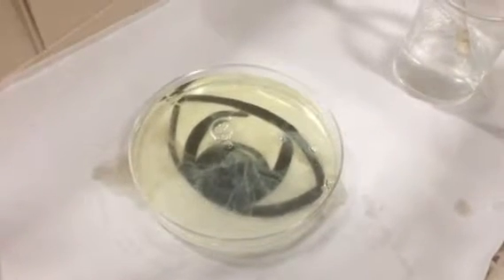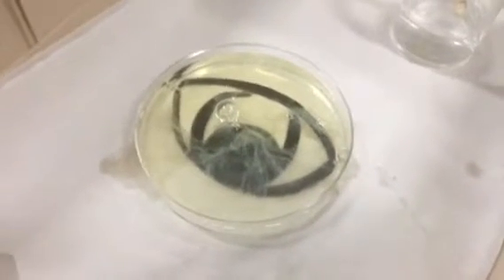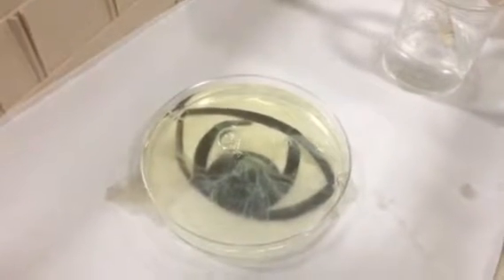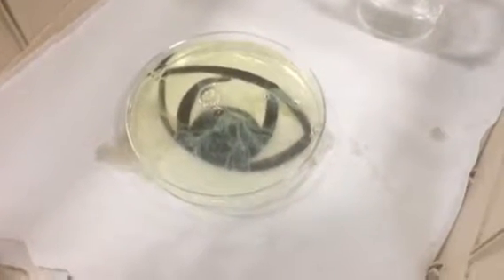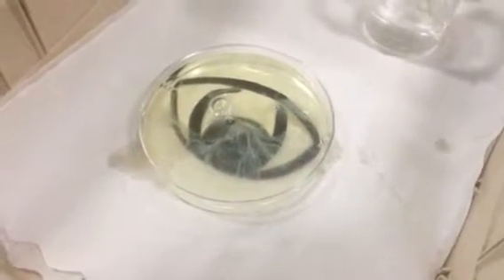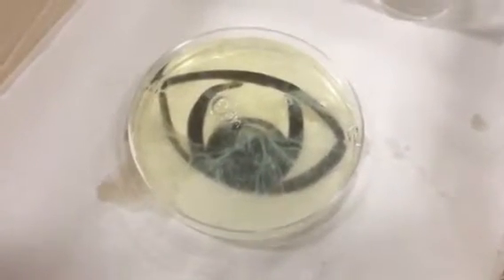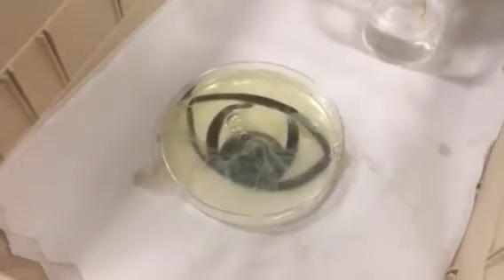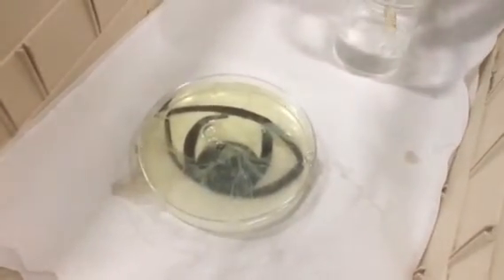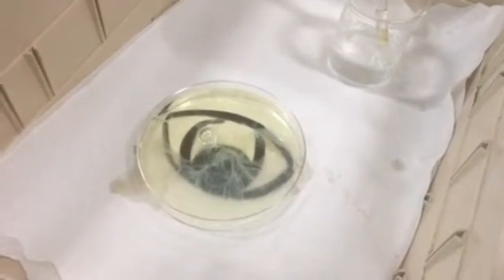So that's why you're going to wear what the whole time you're in the lab? Goggles. But what if your goggles get foggy and kind of annoying and you feel a little uncomfortable? Do you just take them off at the lab table? No. No. Let's say this is your lab table. You'd be like, okay, I'm feeling like you're getting fogged up. You just step back, come along the wall, take them off, breathe, and then when you're ready again, you put them back on. This lab, I'm going to be super strict about goggles.